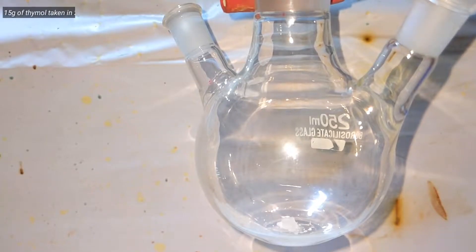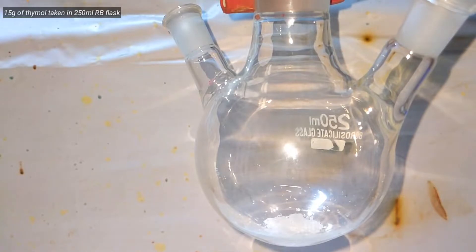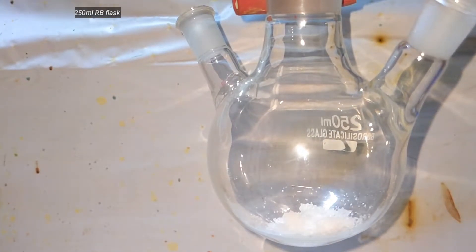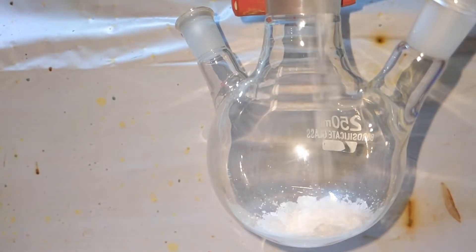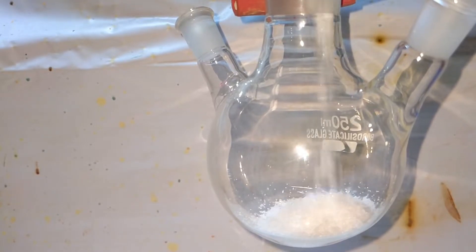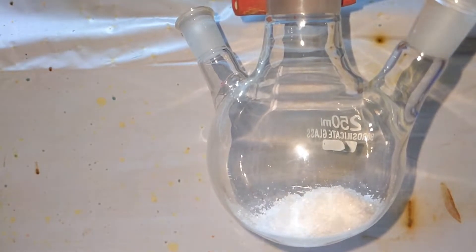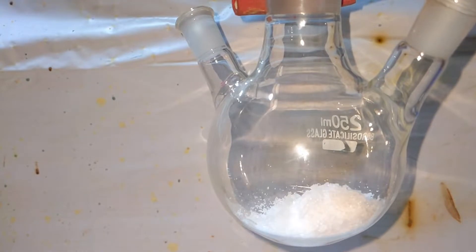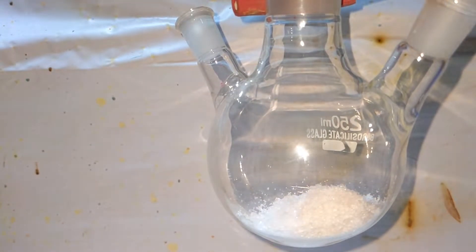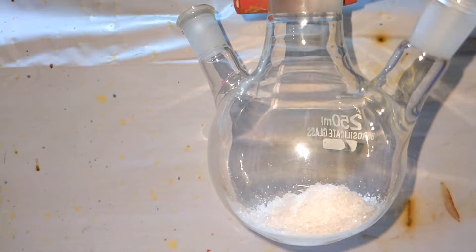Take a 250 milliliter round bottom flask and add 15 grams of thymol to it. Thymol is a phenolic compound with a very pleasant aroma. It is found in the oil of thyme, which is an essential oil. It sublimes in air, so store it in an airtight container.